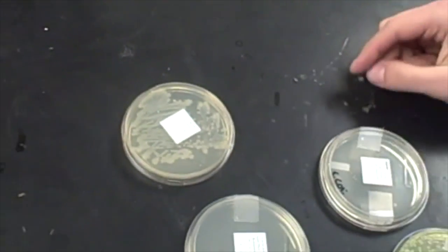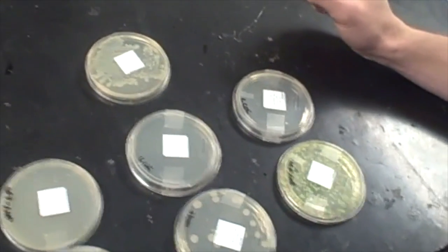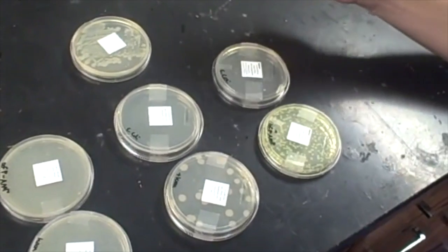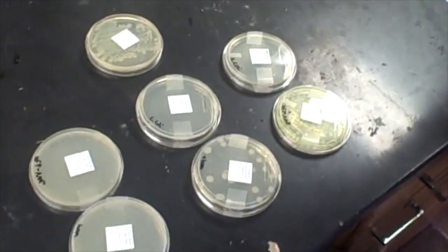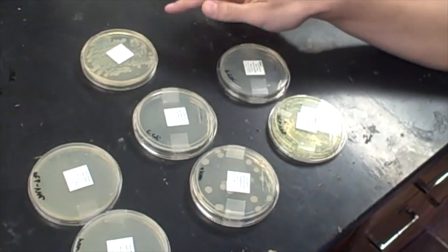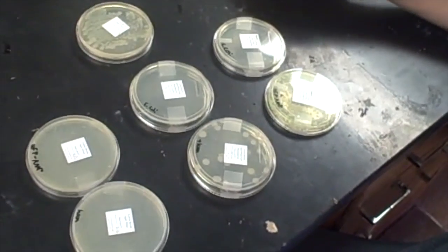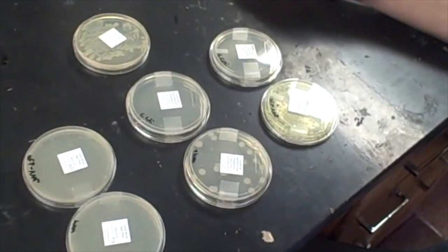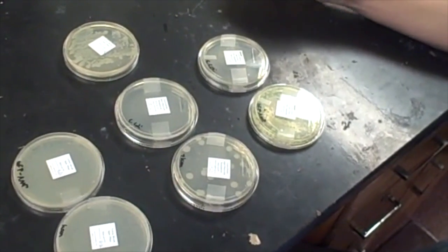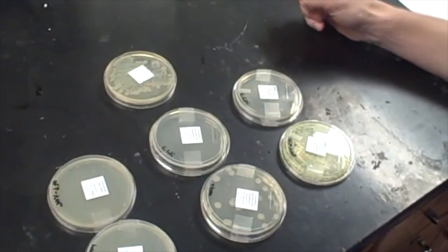And the next day we took some of those colonies, we put them in vials filled with calcium chloride solutions. The calcium chloride increases membrane permeability so they can take the foreign DNA better. We put one colony in 3 different vials. One vial had kanamycin resistant plasmid. Kanamycin is an antibiotic that will kill bacteria. Another vial had ampicillin resistant plasmid in it, and ampicillin is another antibiotic.